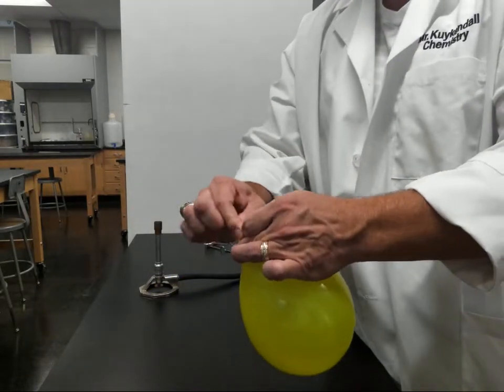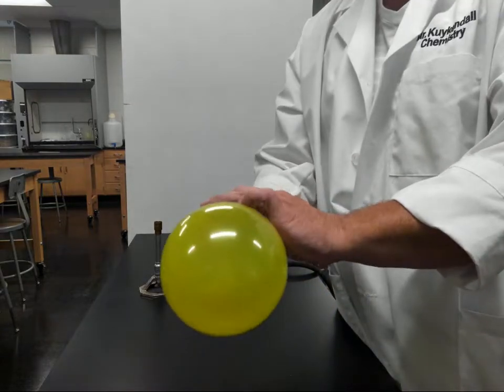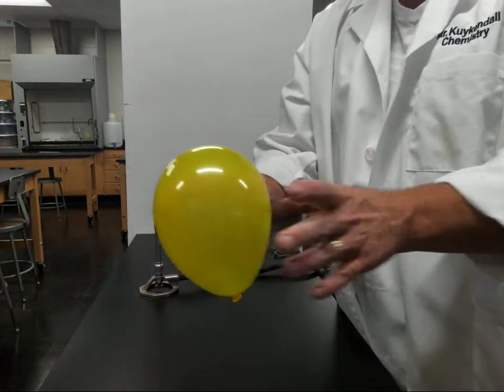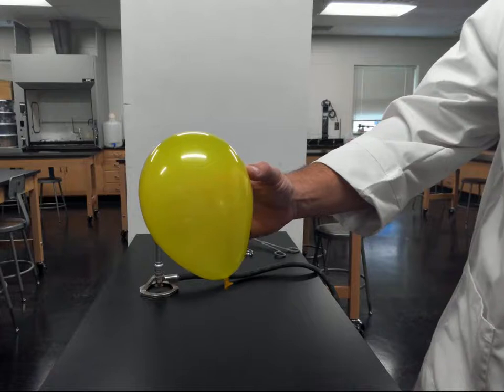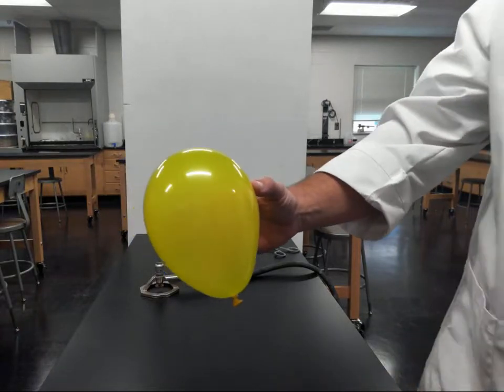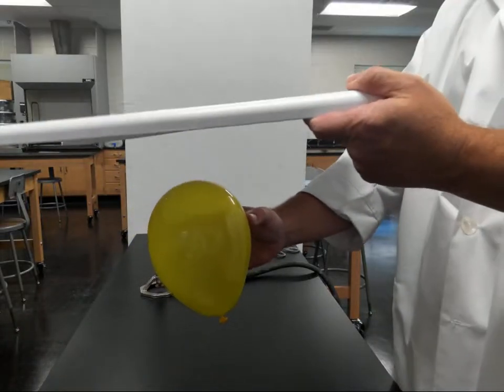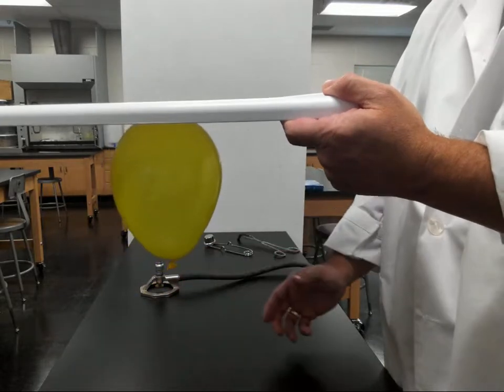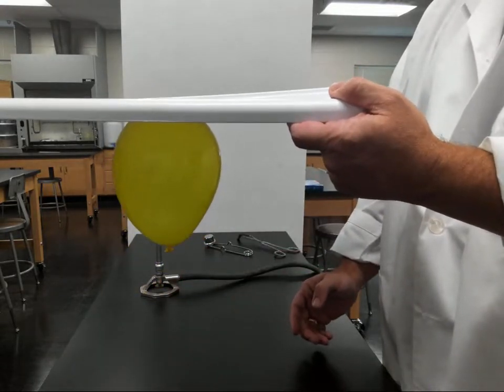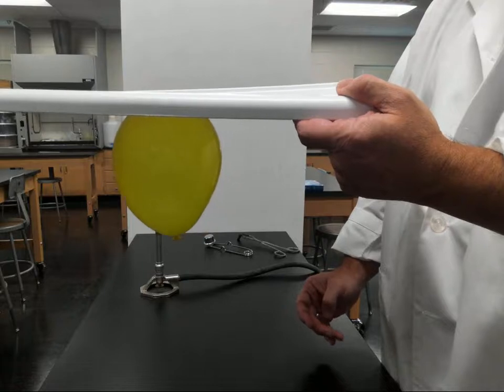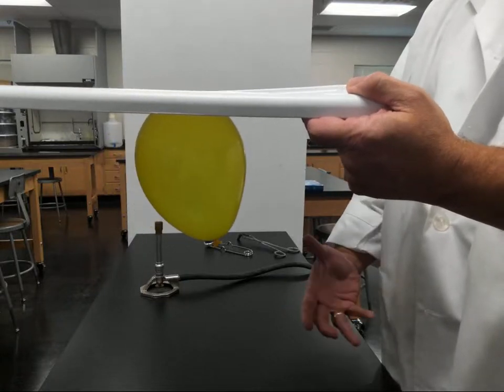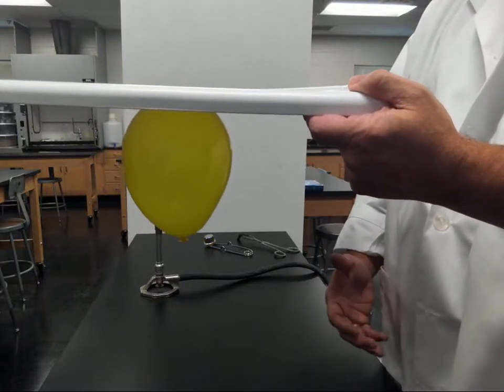I'd like to demonstrate that this particular balloon has properties similar to a gas that students are familiar with. If I actually take a little container here, we can see that this balloon is less dense than air and it is actually trying to float. A nice little property about hydrogen.